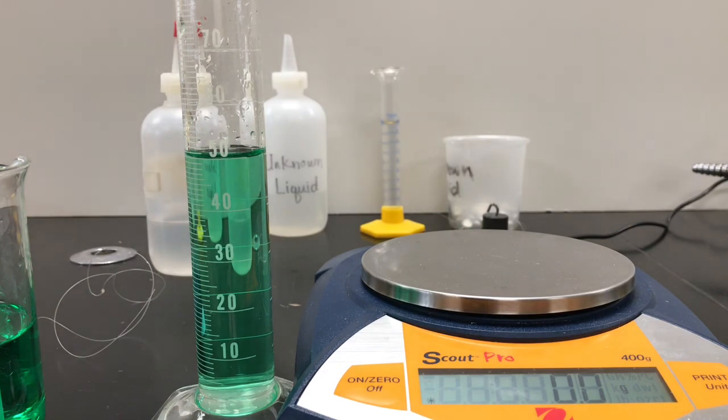So now I have enough information to calculate the density of aluminum, copper, zinc, and the ethyl alcohol. And what we're going to do is try to find the density of 3 unknown materials. And so we're going to take a break, and I'll come back with that.